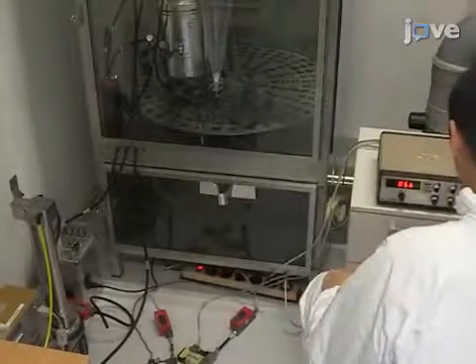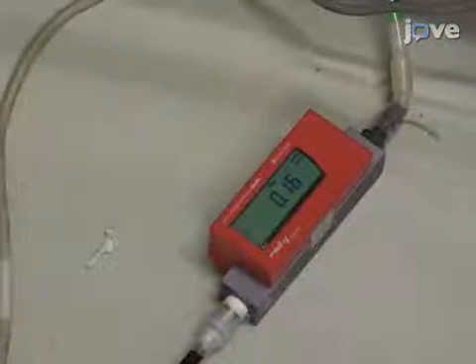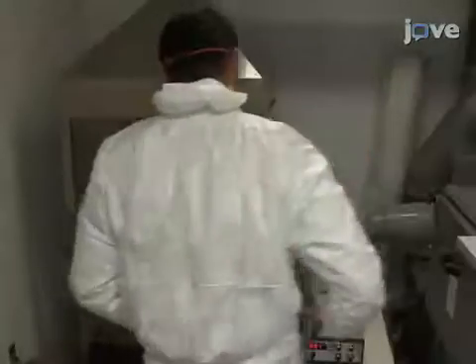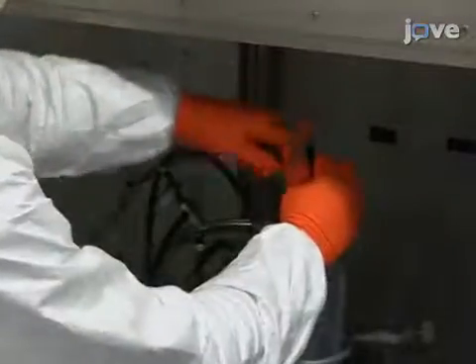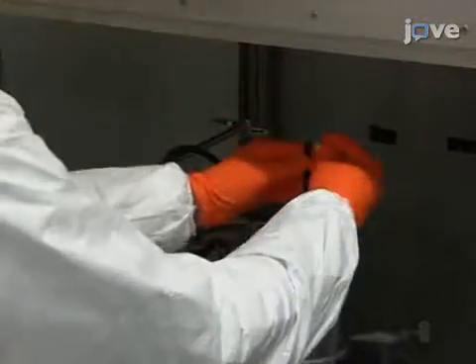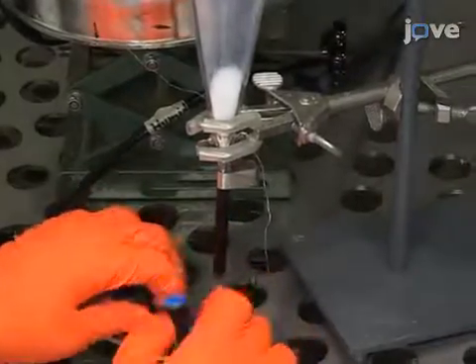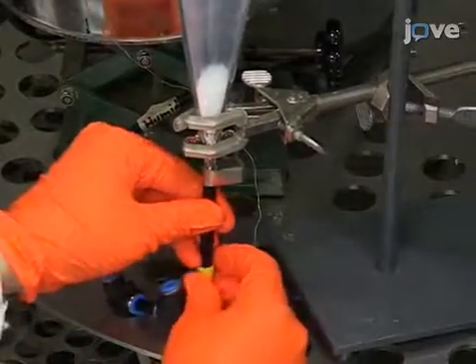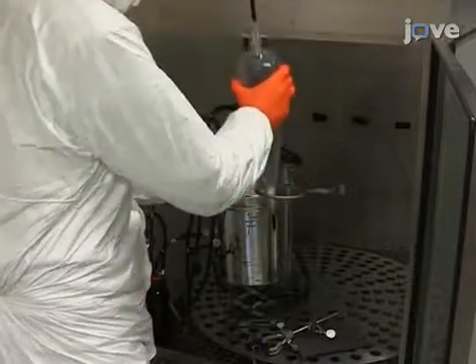After finishing the measurements, begin shutting down the experiment. First, switch off the dilution flow and then the aerosolization flow. Next, move to the aerosol generator. Disconnect the output tubing from the top of the generator and use a plastic cap to prevent powder leakage. Then disconnect the tubing from the generator input and block the bottom opening. Finally, remove the generator from the ventilation chamber.